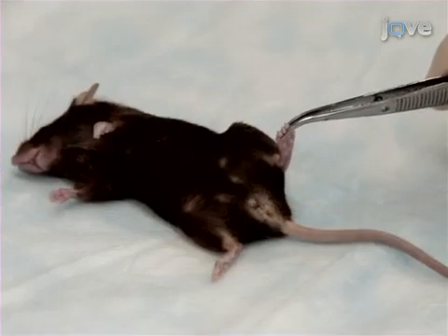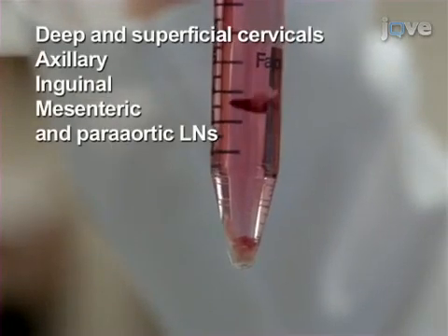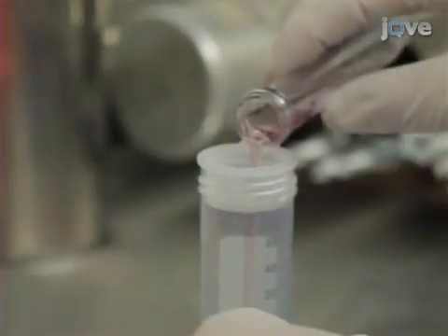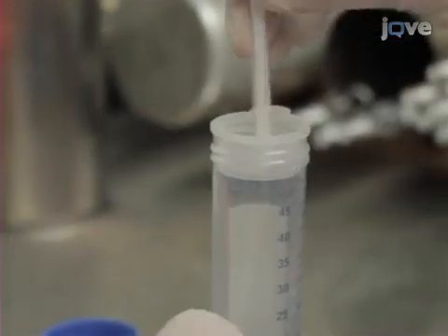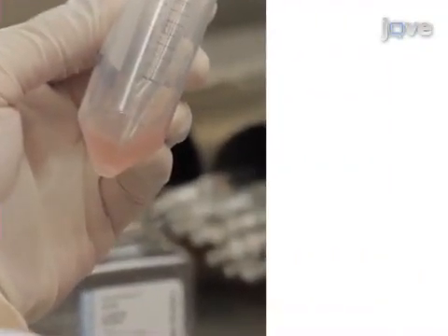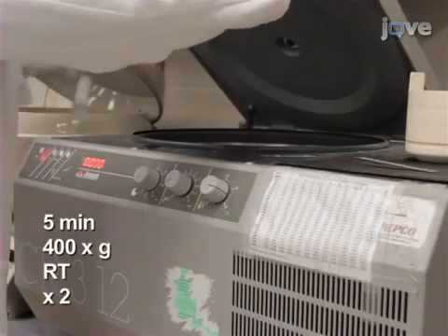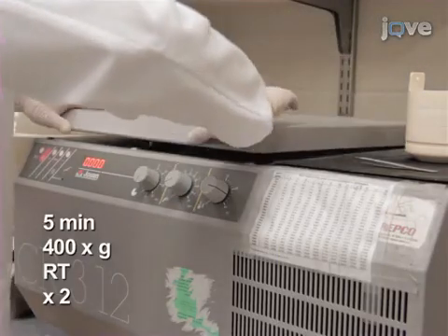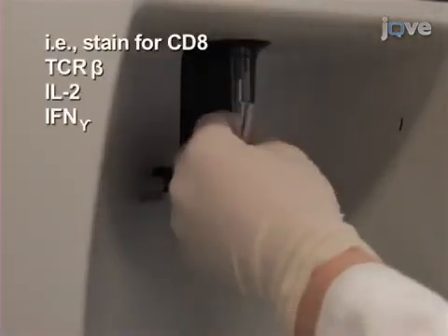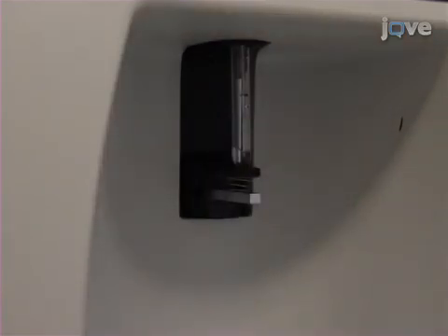3 weeks later, after confirming euthanization of the adoptively transferred mouse, remove the lymph nodes and spleen. After mechanically breaking down the tissues, lyse the single-cell suspension with ACK lysis buffer, and then wash the resulting mononuclear cells twice in cold PBS. Then, after staining for cell surface markers, evaluate the cells by flow cytometric analysis.